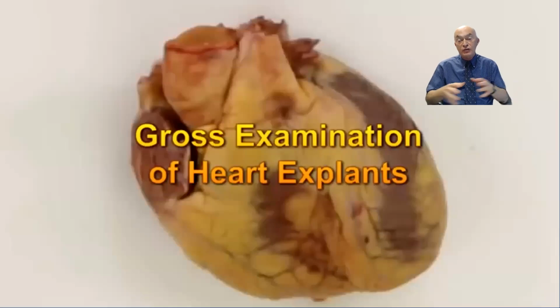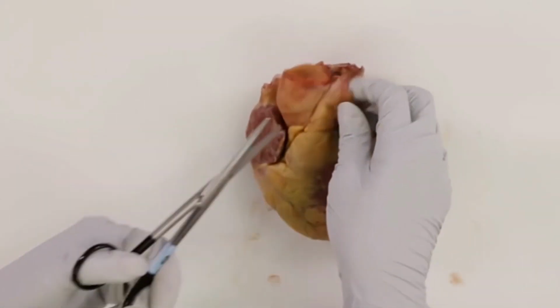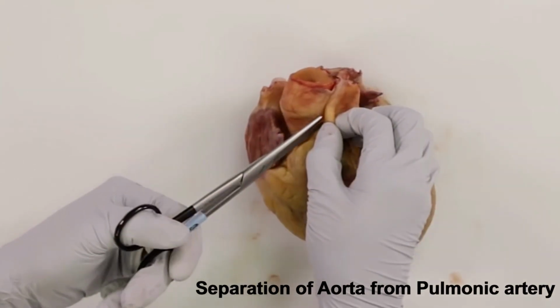Now I'm going to show you a video that I have edited. This is a video that I took from YouTube, and it was produced by the Department of Pathology and Laboratory Medicine of the Weill Cornell Medicine Hospital, and I edited it a couple of years ago. And it was entitled Gross Examination of the Heart Explants.